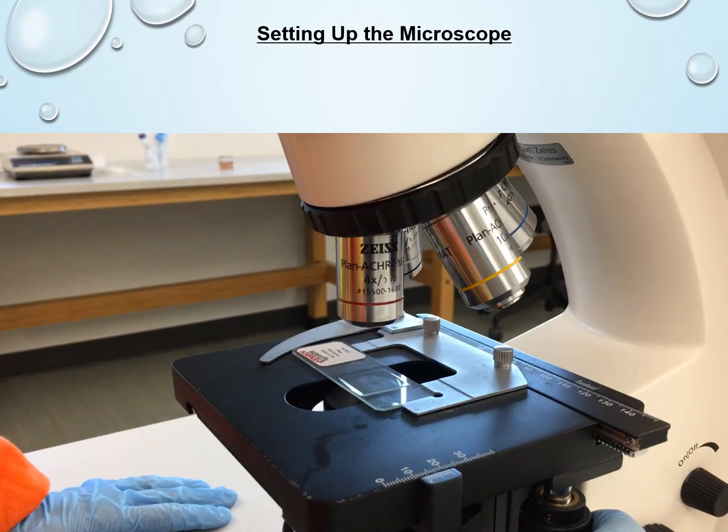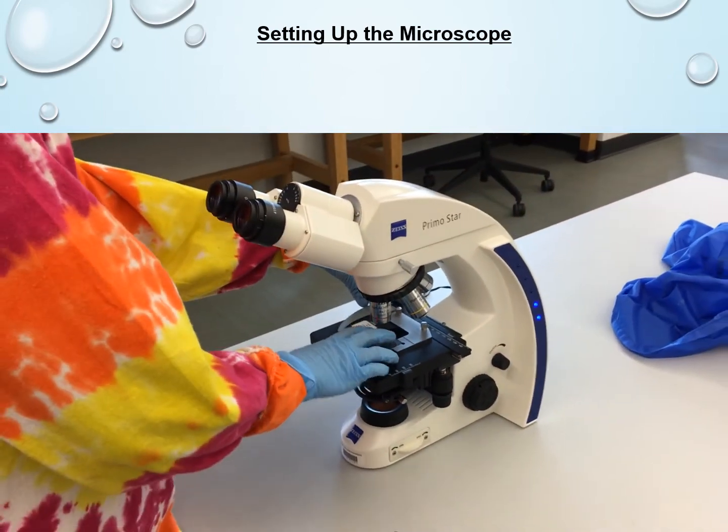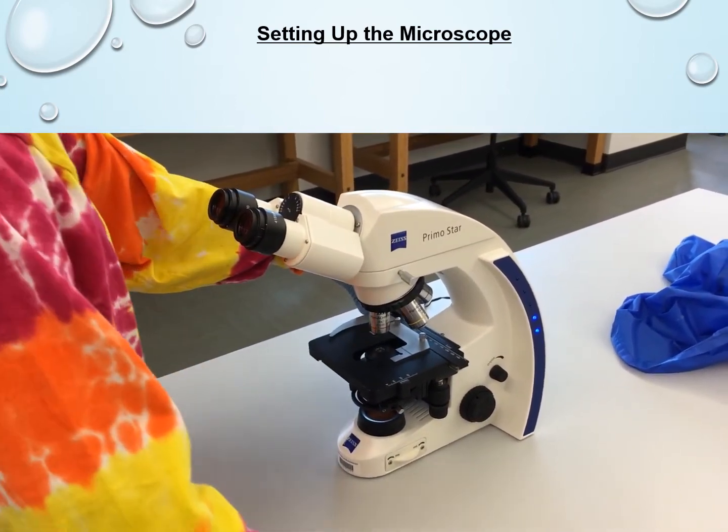You'll also notice that Emily is now adjusting this knob underneath the stage on the right-hand side. You'll see it when I start playing the video again, to bring the specimen that you want to see right into the center of the view. So it should be positioned right underneath the objective so that you're more likely to find it when you're looking through the eyepiece. And then, of course, once it's in the center, you can start bringing the stage up and down as you're looking through the eyepiece to actually get your image into focus. Okay, so Emily's positioning it in the center, and that's how you would actually look for the specimen.